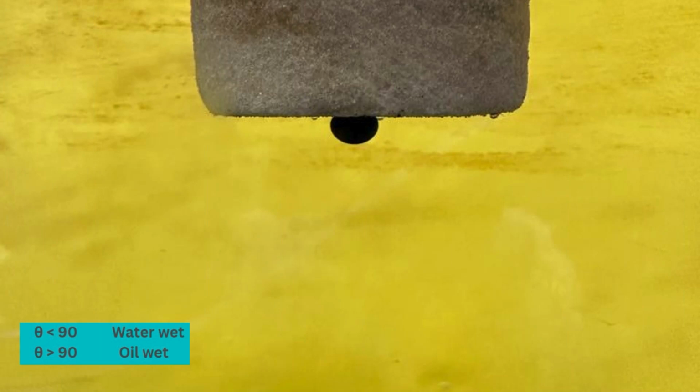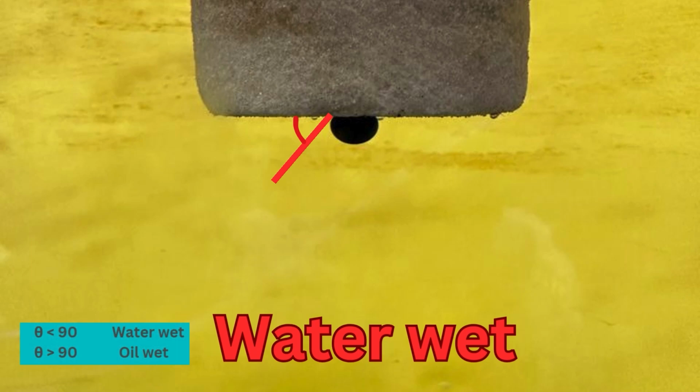And as you can see in the picture, we took the angle of the denser fluid, which is water. And the angle here is less than 90, so it's water wet.